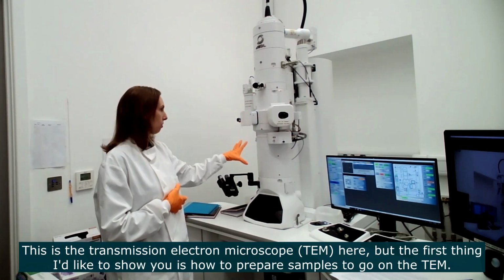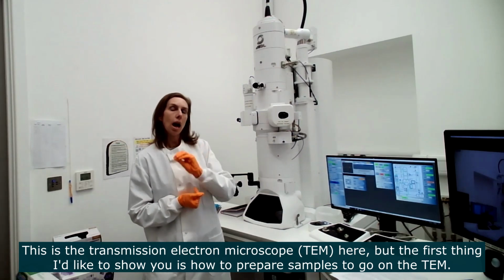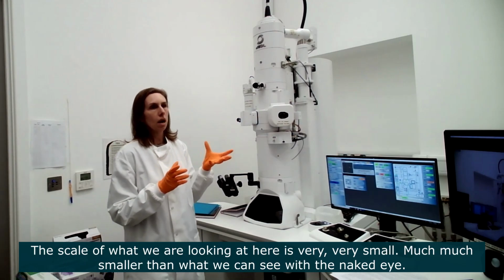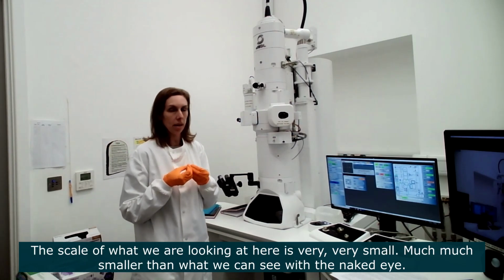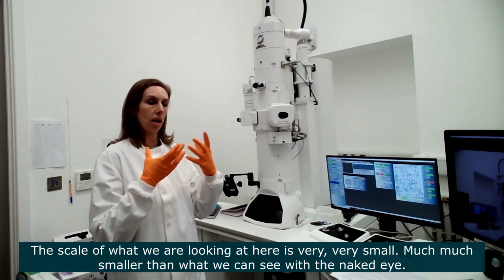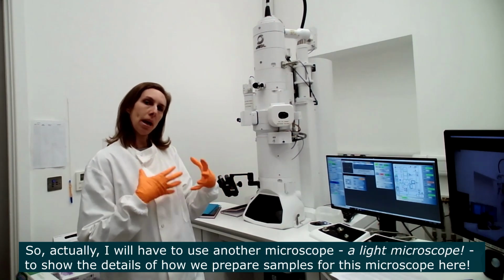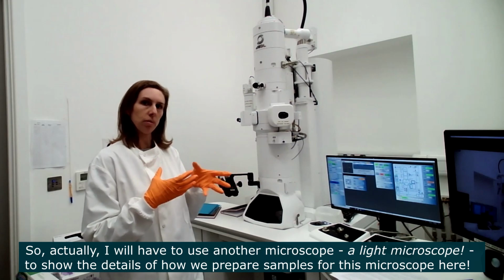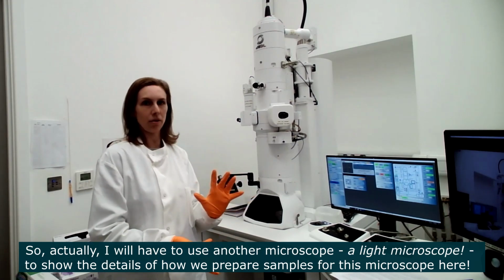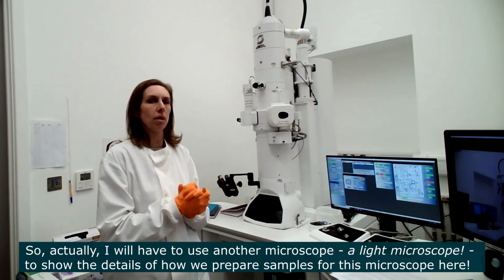So this is the microscope here, but the first thing I would like to do with you is show you how we prepare samples to go on the microscope. The scale of what we're looking at here is very, very, very small, much, much smaller than the scale that we can see with the naked eye. So to show you how we prepare samples to go on this microscope, I'll actually have to use another microscope, a smaller one, a light microscope, that will show you the very, very small samples and the details of the sample prep.